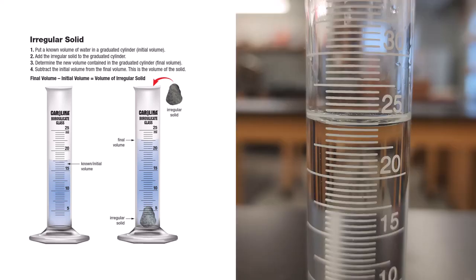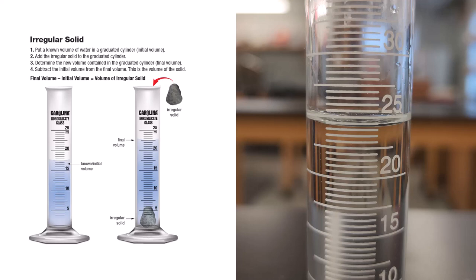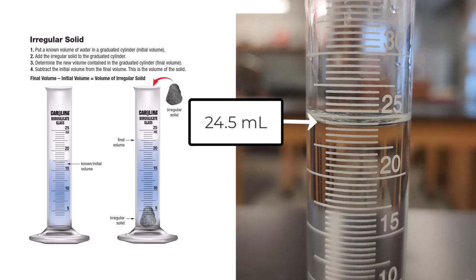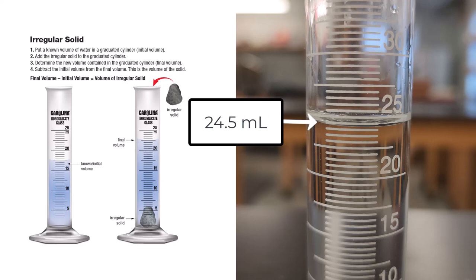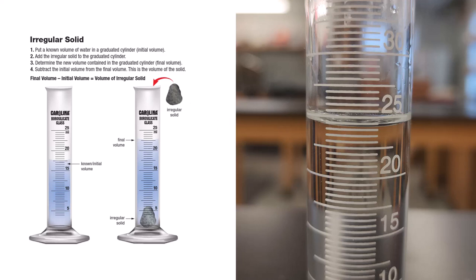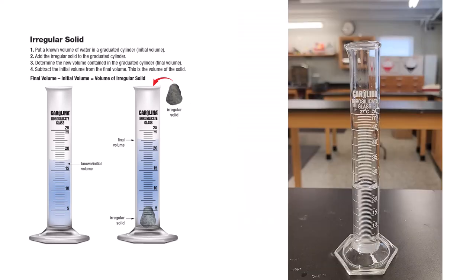Examine the water at eye level. Read the numbered mark at the lowest point of the meniscus. In this example, the lowest point of the meniscus is at 24.5 mL. This is the initial volume.